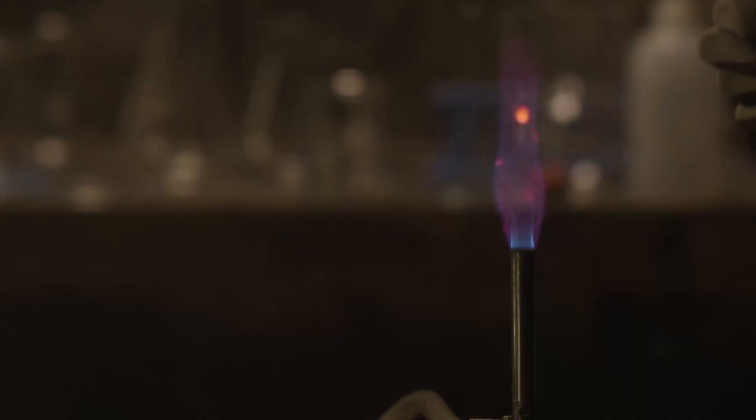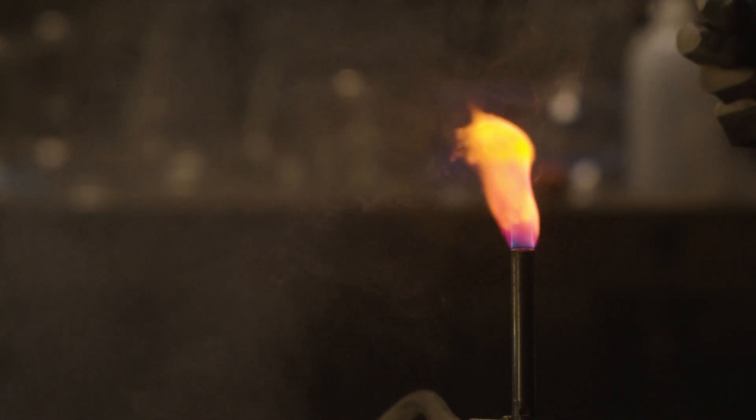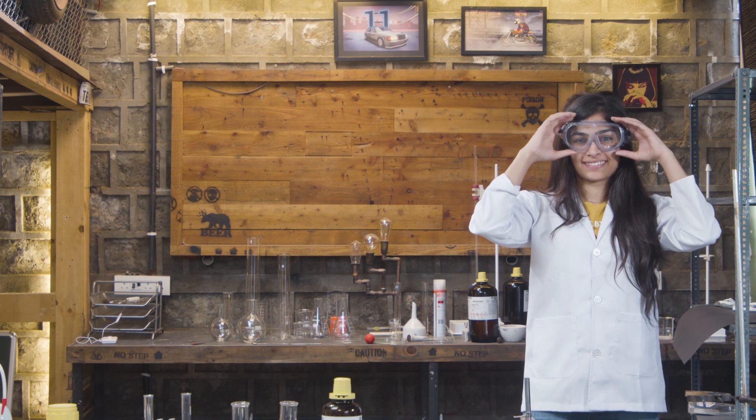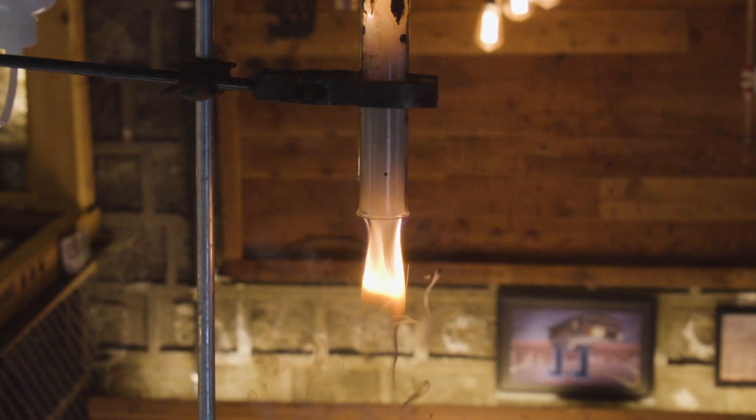We did do some dangerous stuff, but all of that is nothing in comparison to what we are about to do today. So hold on to whatever you can, cause the science train is in full throttle.